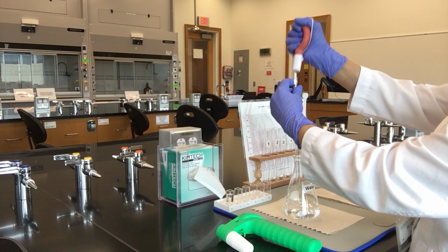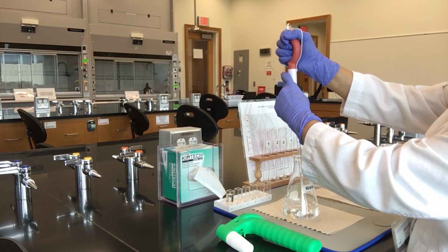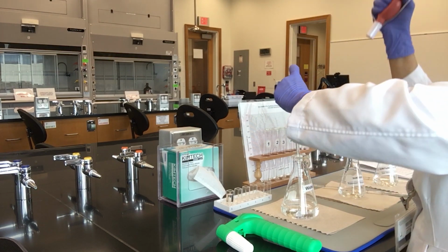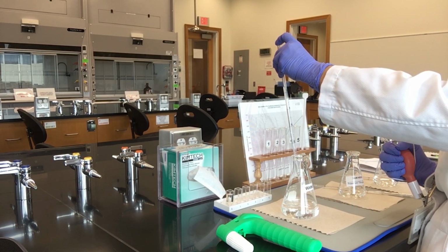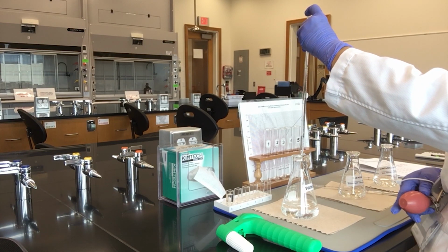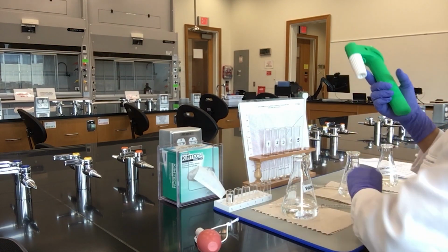If you use the rubber bulb, fit this on top of the pipette. Squeeze the bulb to eject air from the pipette and submerge the tip into the water. Gently relax the rubber bulb to suck fluid into the pipette. Do not allow fluid to rise all the way into the rubber bulb. If this happens, immediately wash the inside of the bulb with lots of water and dry with paper towel.